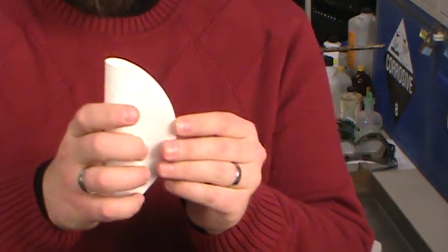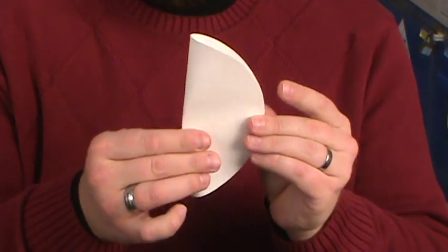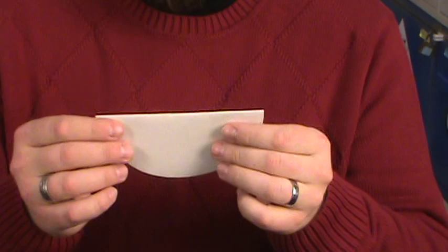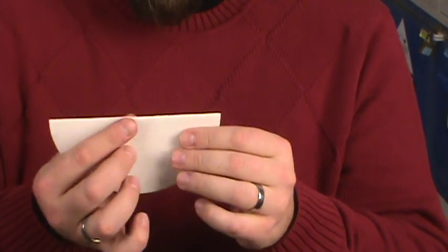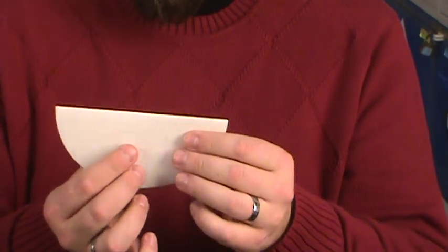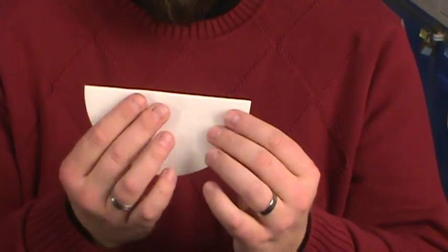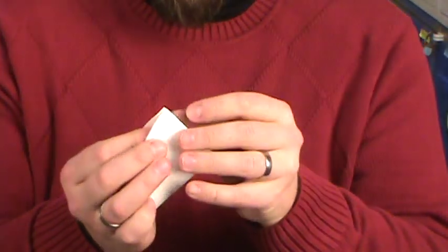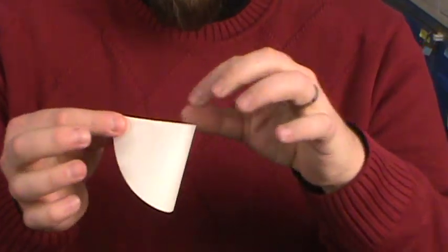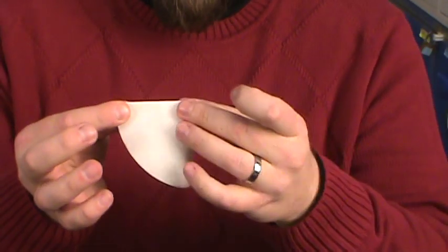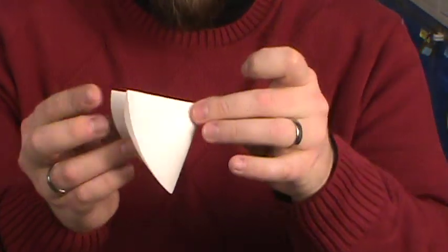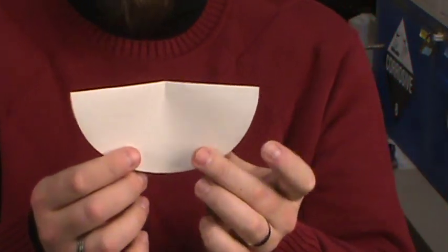To make a fluted filter paper we're going to start the same way. Let's fold this in half - again don't make your creases too aggressive or else you'll break through. And now I need to figure out where the center of this is, so I'm going to fold this in half not to fold it, but let's line those up and I'm just going to give the center a little crease or a little pinch so I can see where the center is. So now I've got my half moon of filter paper, I can see where the center is.